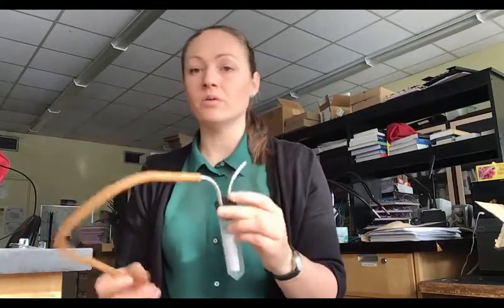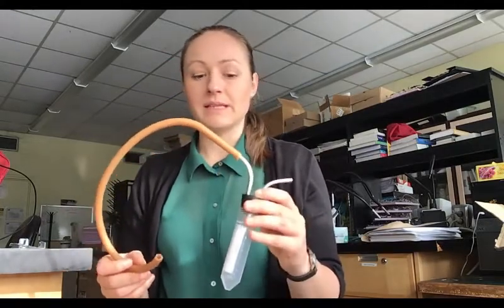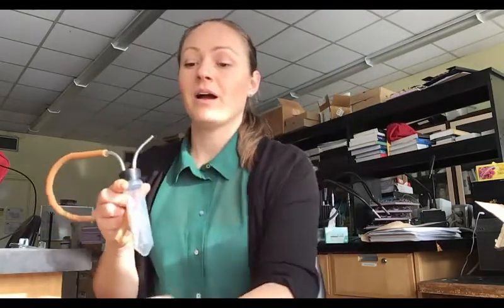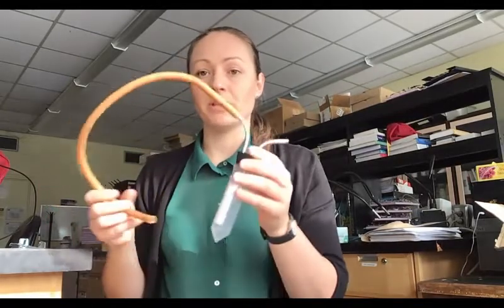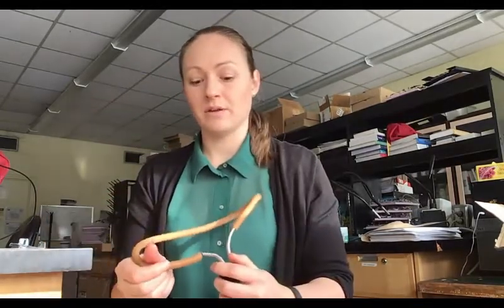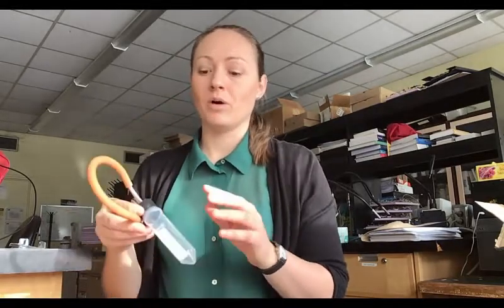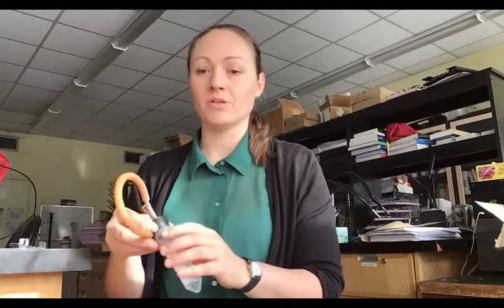After you're done collecting for the day, if you find mosquitoes are flying around and you can't quite take this off and stick the lid on, one option is putting the whole device in the fridge or freezer. Once the mosquitoes calm down, you can swap the lid. Just take off the stopper, put the lid on, and keep your mosquito samples in the freezer.